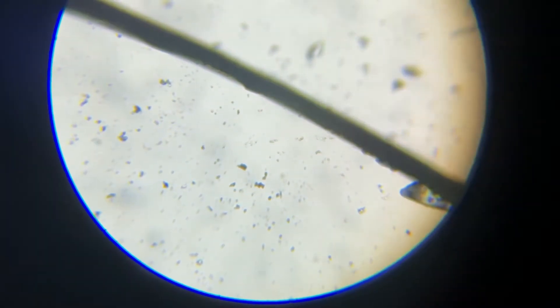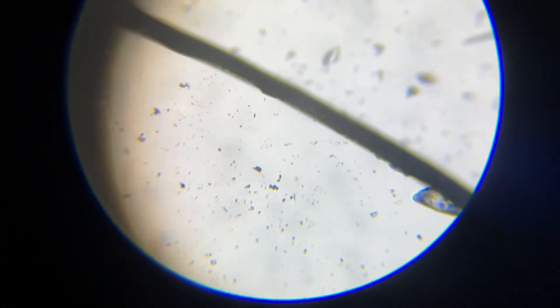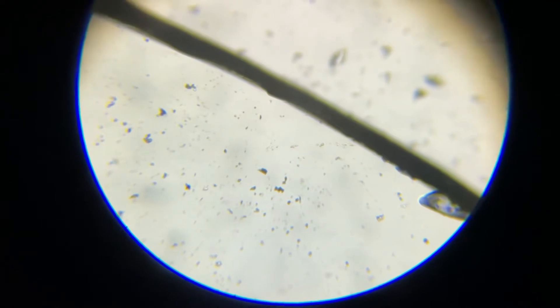It's kind of blurry so we've got to use some adjustments. Right now I want to switch it to the minimum — let's see if that's okay. There, as you can see on the screen hopefully, is a pine tree leaf — it's kind of like a needle. Now let's try switching it out for something else; you can put these back by placing them in these tiny slots.